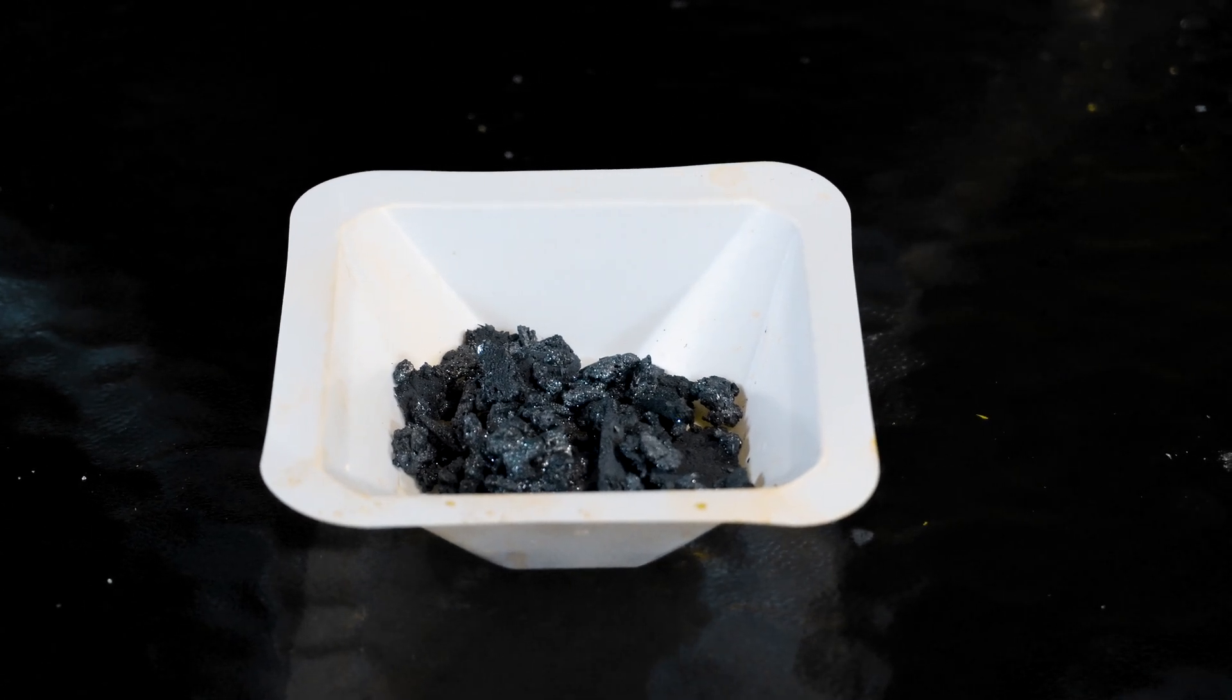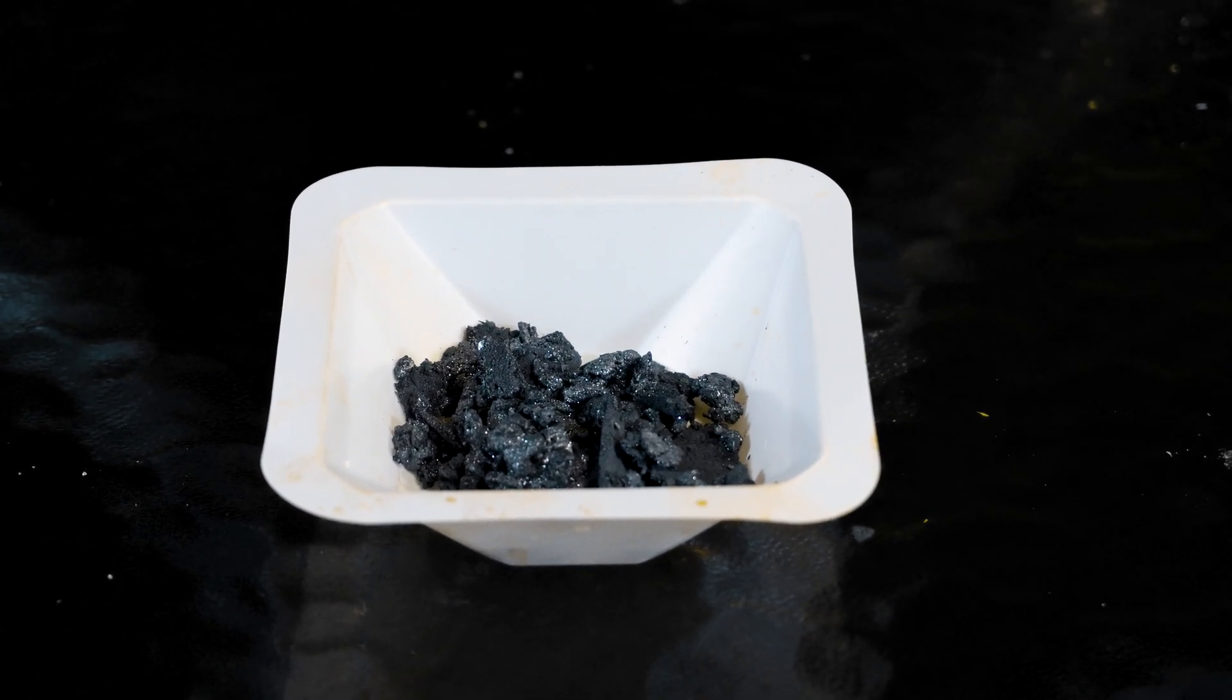Oh, iodine. Both beautiful and pretty dangerous. It's my kind of element.